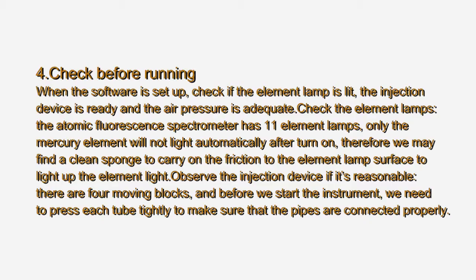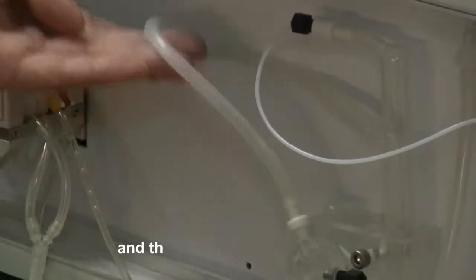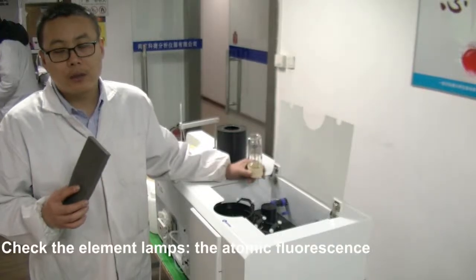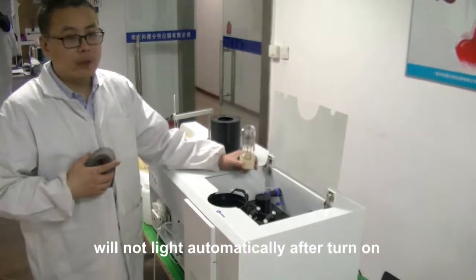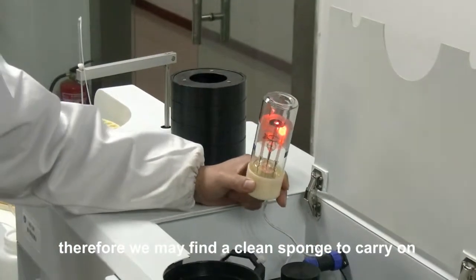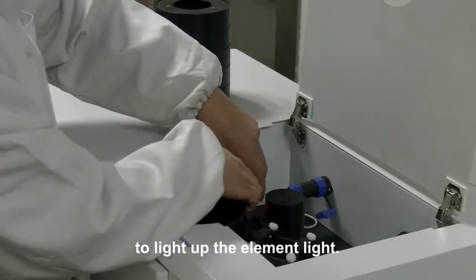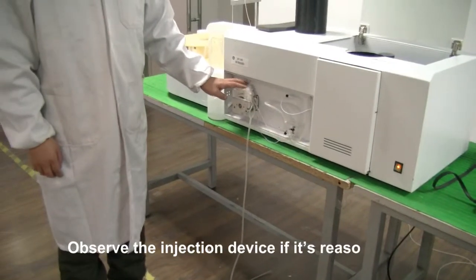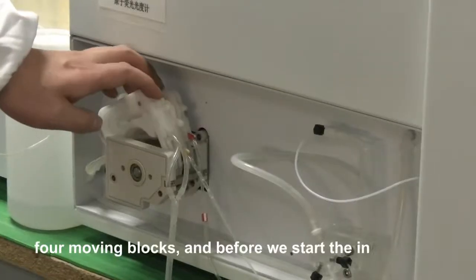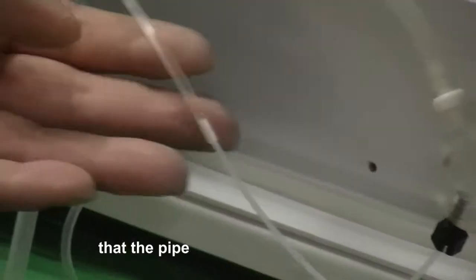Step 4 — Check Before Running. When the software is set up, check if the element lamp is lit, the injection device is ready, and the air pressure is adequate. The atomic fluorescence spectrometer has 11 element lamps. Only the mercury element lamp will not light automatically after power-on. Therefore, use a clean sponge to rub the element lamp surface to light it up. Observe the injection device to ensure it is properly arranged — there are 4 moving blocks. Before starting the instrument, press each tube tightly to make sure that the pipes are connected properly.